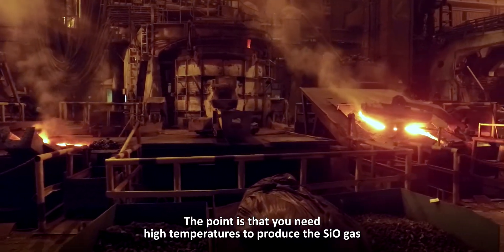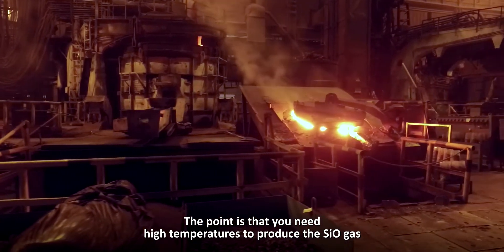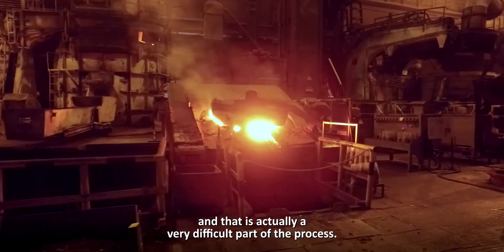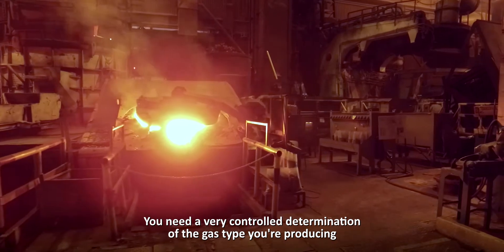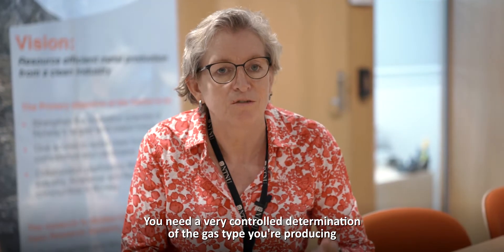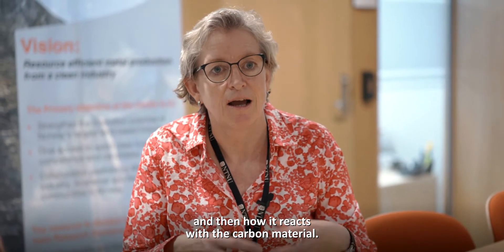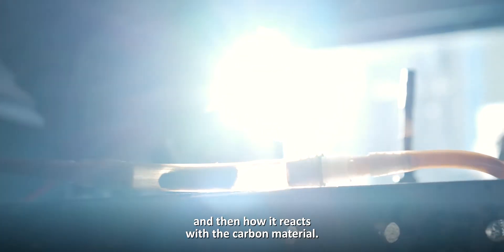You need high temperatures to produce the SiO gas, and that is a very difficult part of the process. So you need a very controlled determination of what kind of gas you are producing, and then how it reacts with the carbon material.